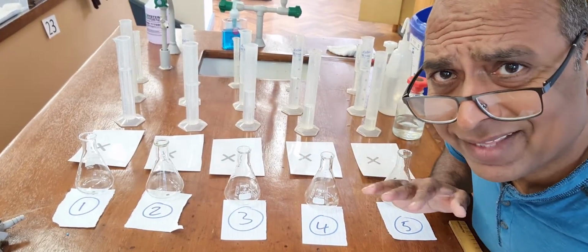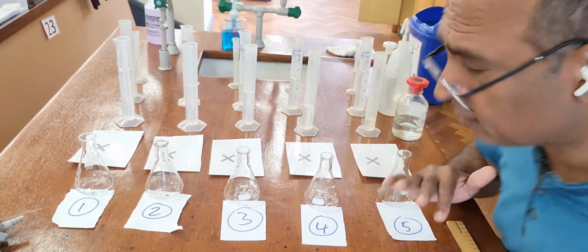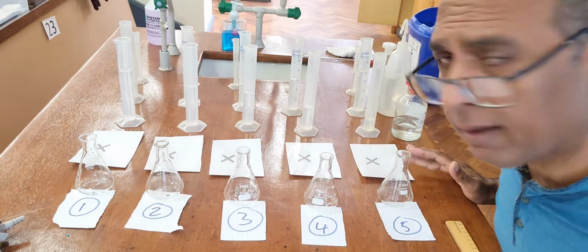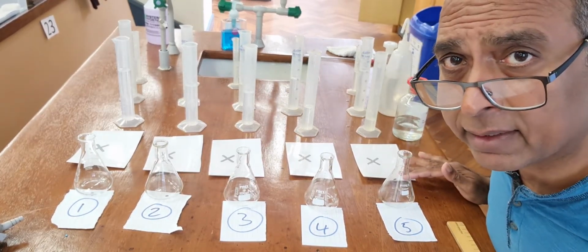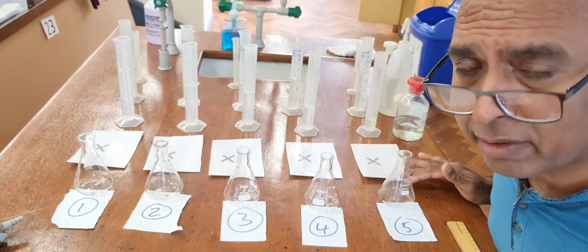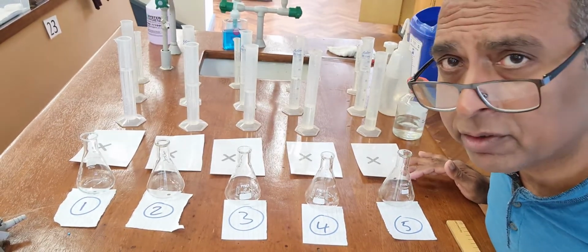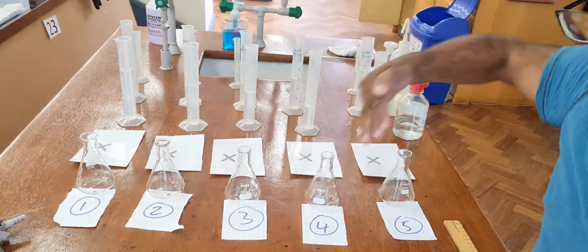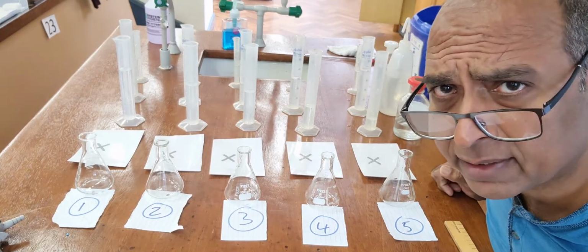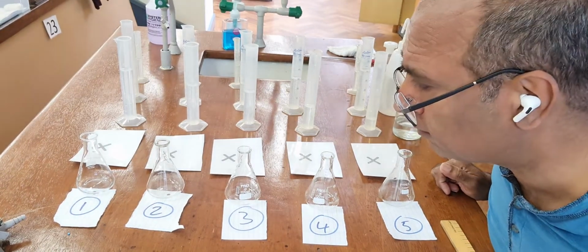So I've got that table that I showed you, practical, ready here. I hope it's ready. I've never done all 5 together like this. And I'm sorry, I couldn't get hold of 5 stop clocks. So I'm going to do each one of the 5 experiments with a 30-second delay. And in that way, I'm hoping to get them all done.